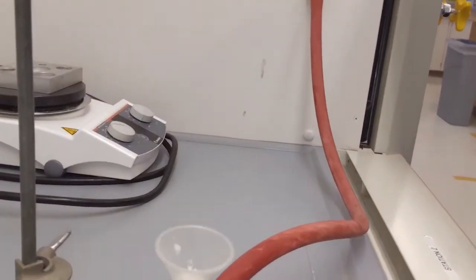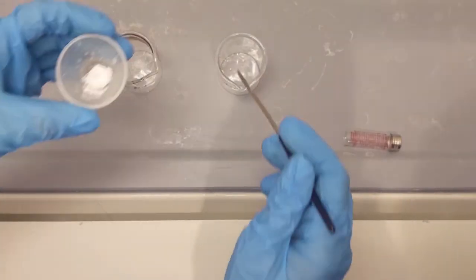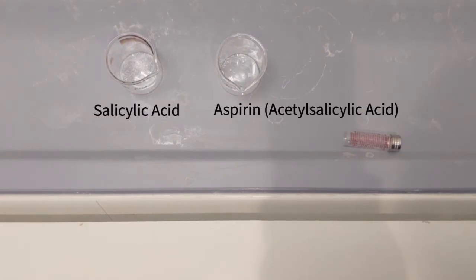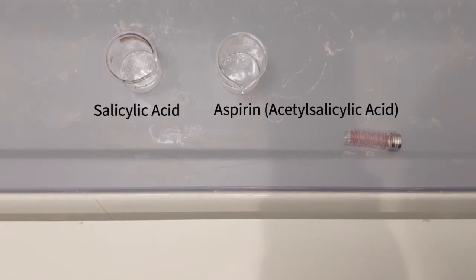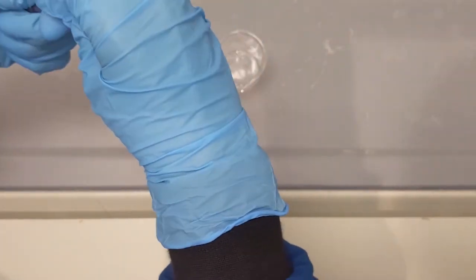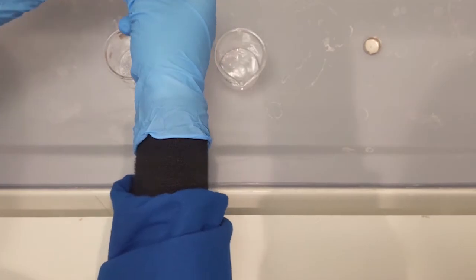Let air run through your filtered solid for 5 to 10 minutes to dry it properly. For TLC testing, take some of your final product into a beaker and take some of your starting product, which is salicylic acid, into another beaker and dissolve them in acetone. Make sure to not add too much acetone so as not to have a too dilute of a solution.